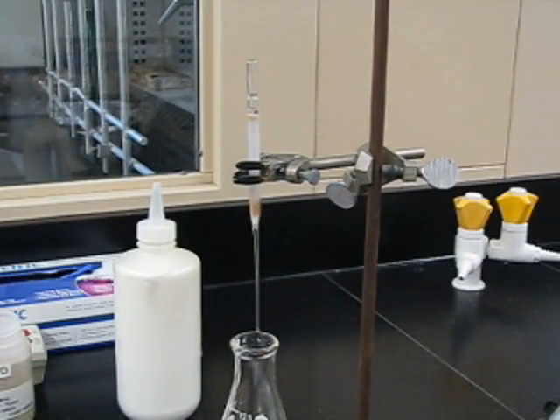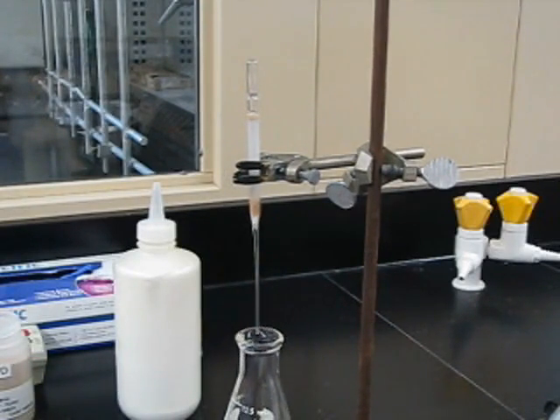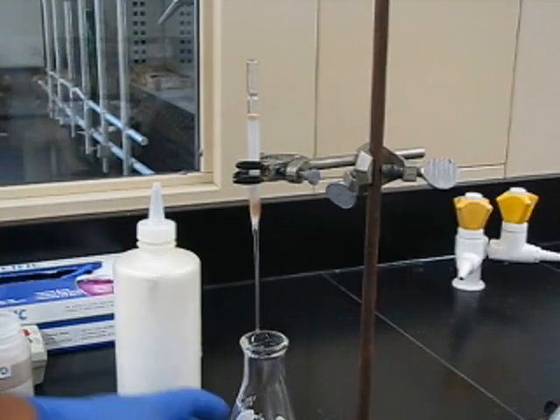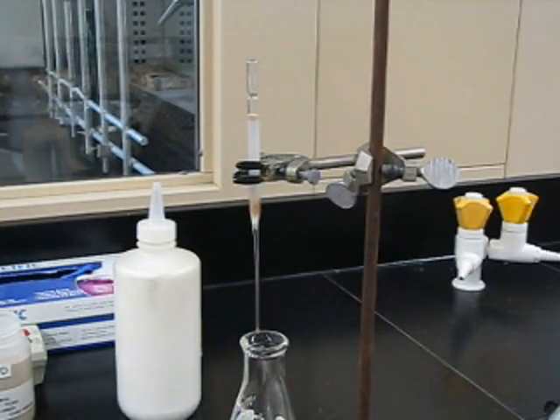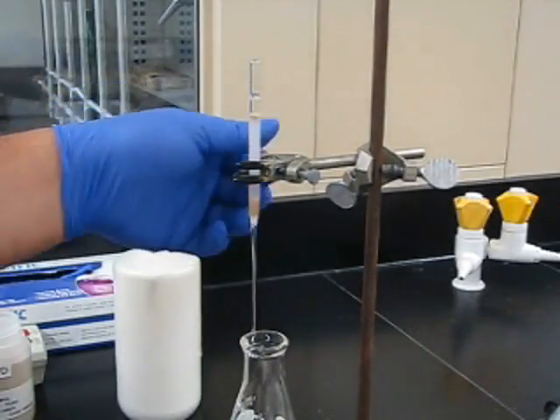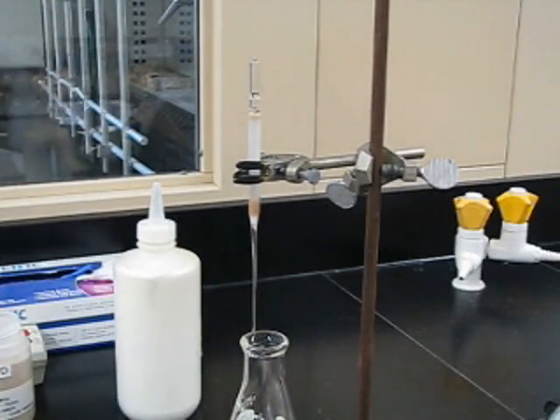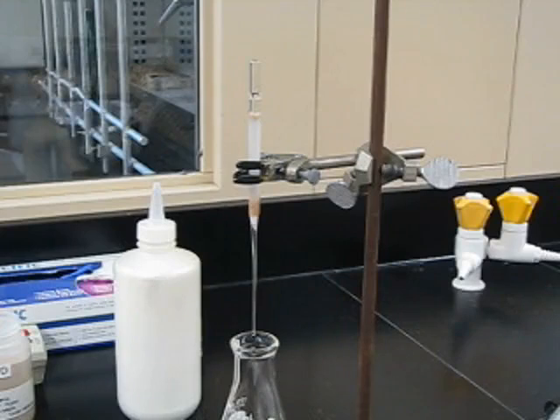You'll see that as soon as the solvent reaches the sand, watch the bottom of the pipette. It comes to a stop. As long as you're not applying pressure, this is what will happen. So don't worry about it going, quote unquote, running dry. As soon as you add solvent again, look at the bottom of the pipette. There it goes. And it's going to stop again once the solvent reaches the sand.